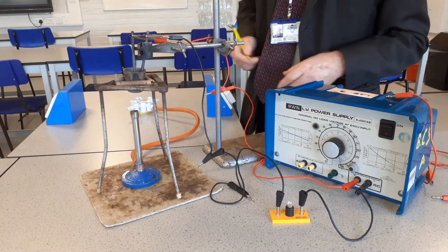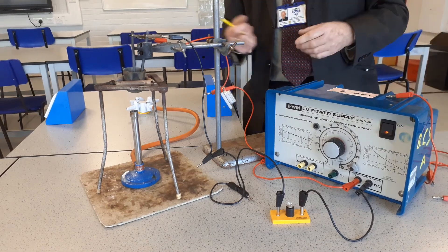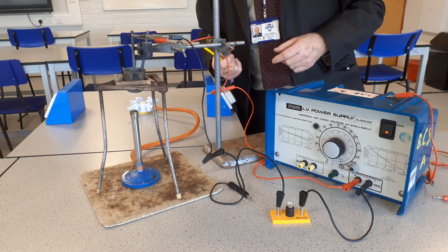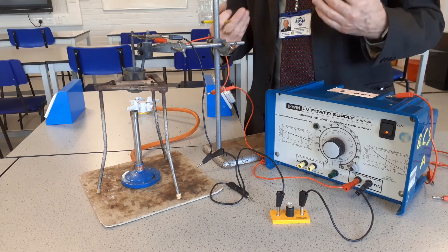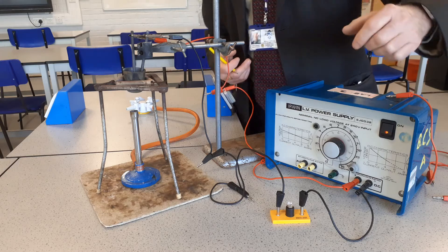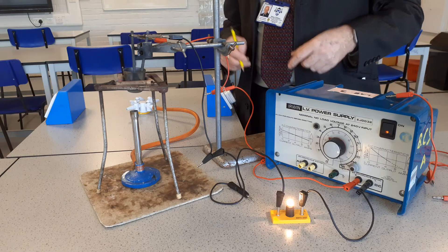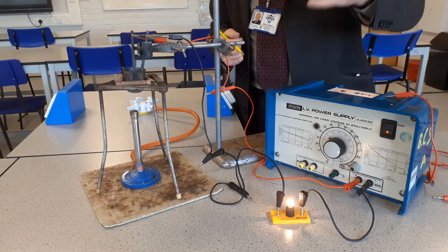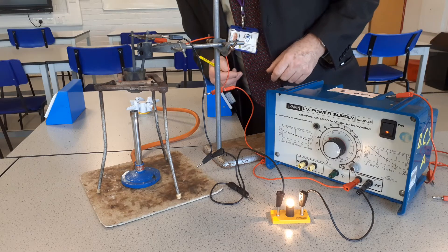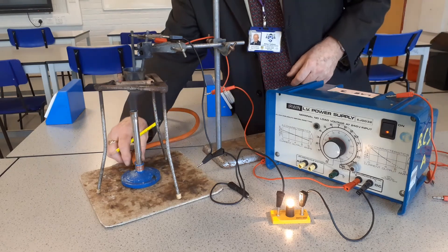What I'm doing now is using a roaring flame to melt the lead bromide. As you can see, because the lead bromide isn't melted yet, there's no conduction occurring — because we've got a solid, the ions are not free to move. Now the lead bromide is molten, our lamp is lit, showing that conduction is occurring, because the ions are now free to move and to carry the charge.